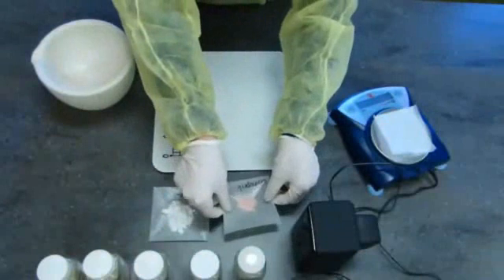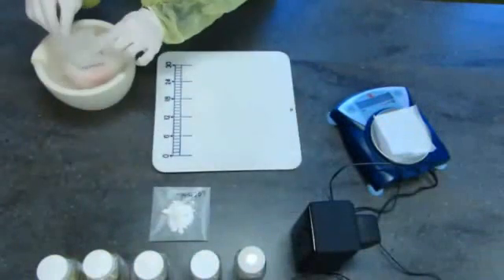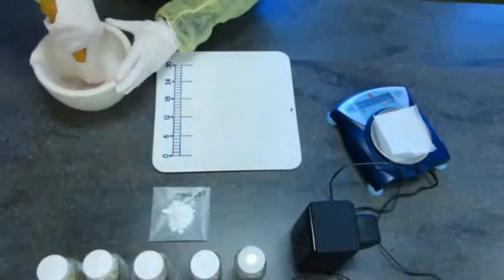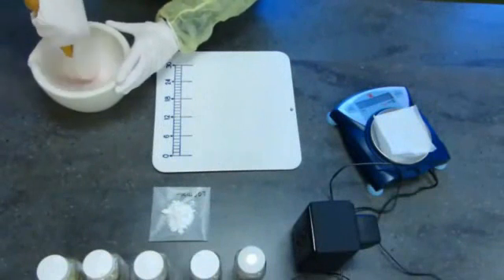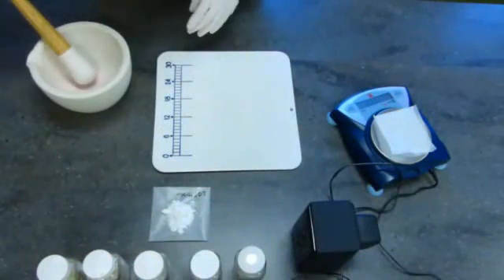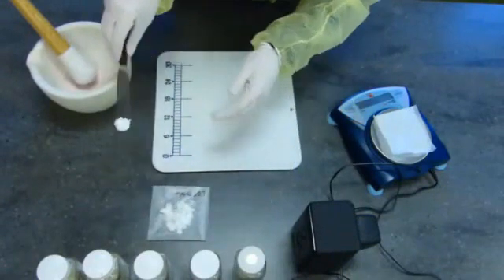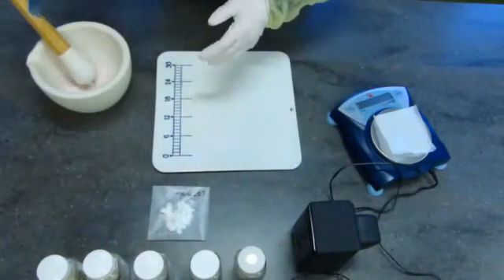Components that will be punched into the capsule should be triturated in a mortar and pestle to as fine a powder as possible. Geometric dilution should be used if there is a threefold or greater difference in the weights of the powders to be combined.